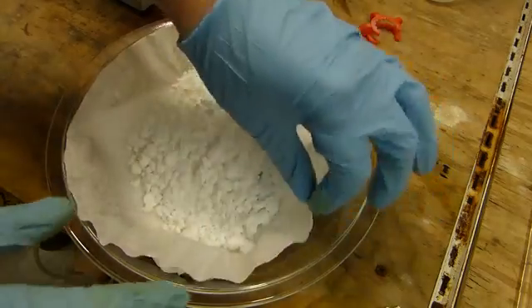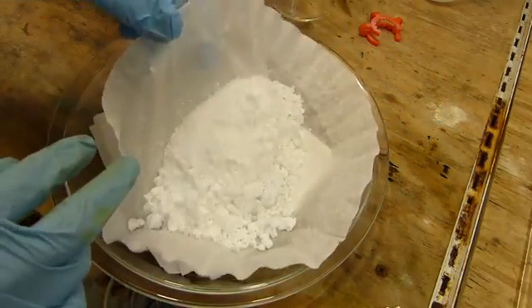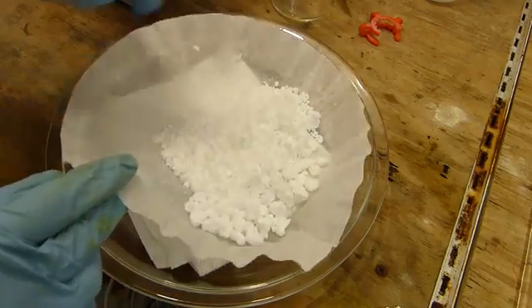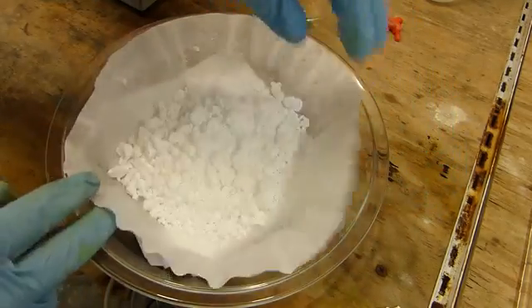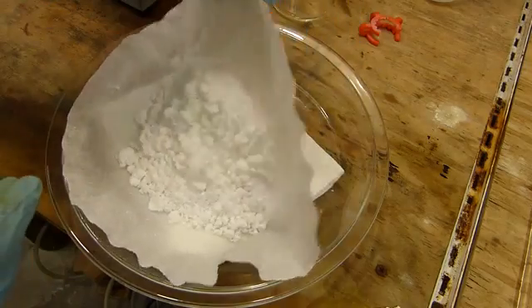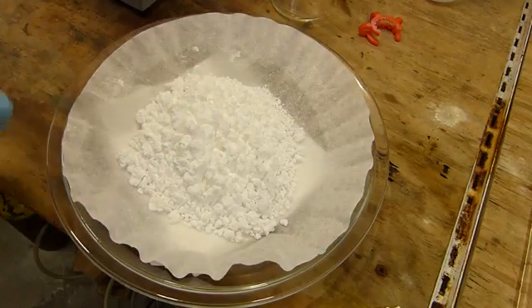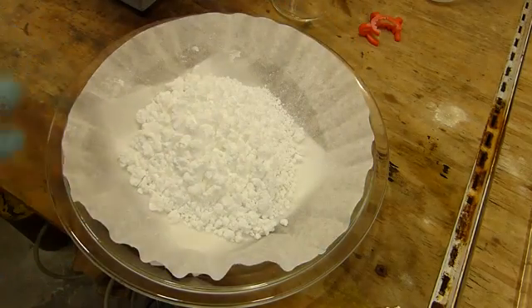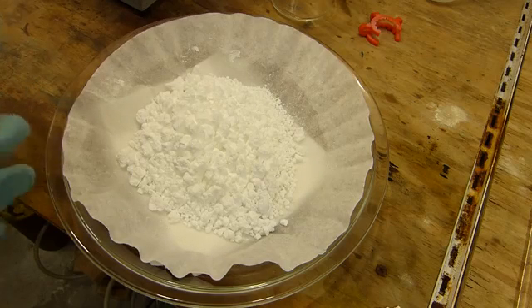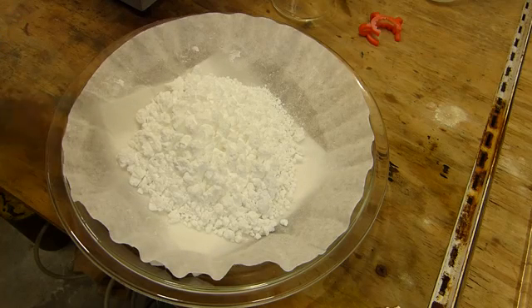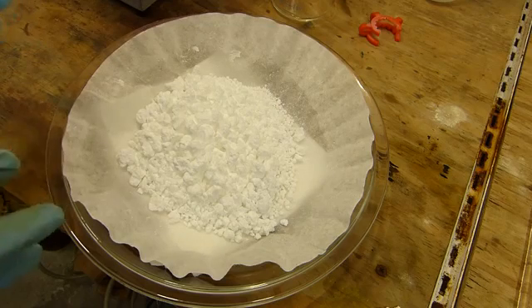It's been a few hours and the benzoic acid is now mostly dry. You can see it's sort of starting to free flow a little bit, a little bit of chunks. So a little bit of water still, but mostly dry, dry enough for the next step, which is recrystallization. So to make sure that this is completely free of potassium chloride and any sodium benzoate and things like that, we're going to recrystallize it from water.